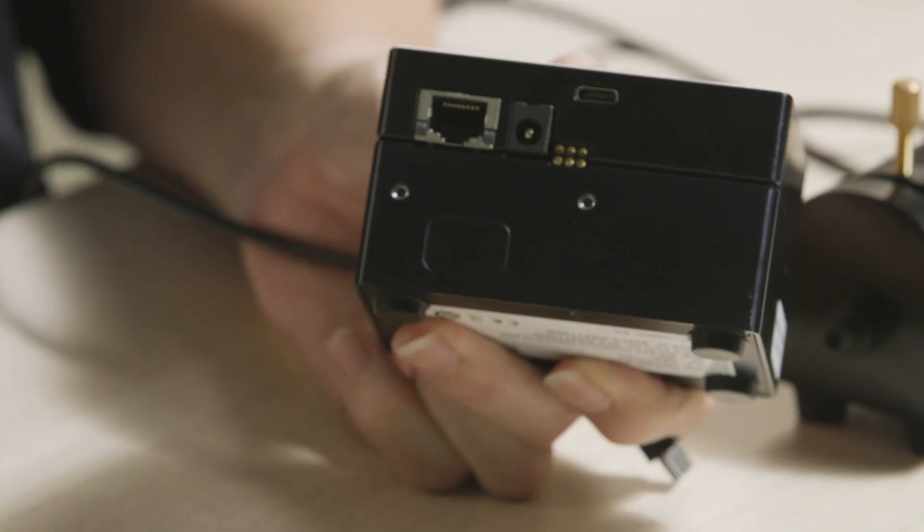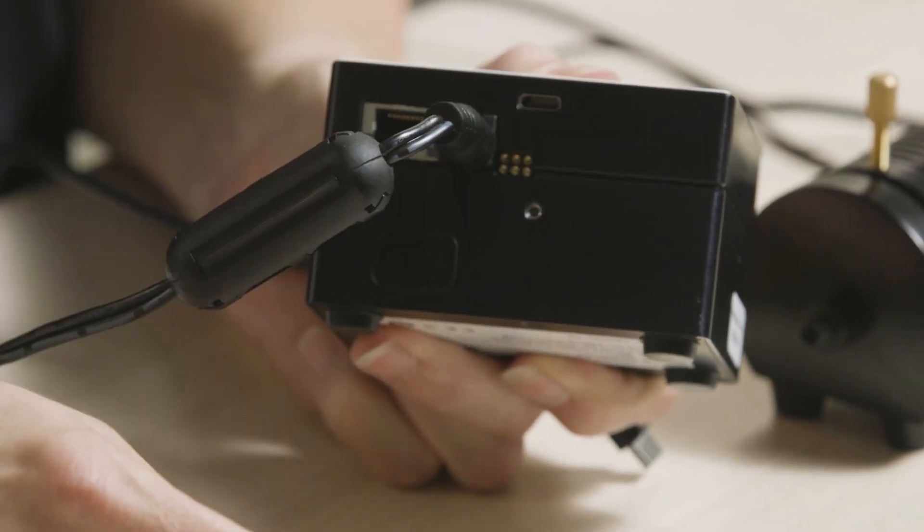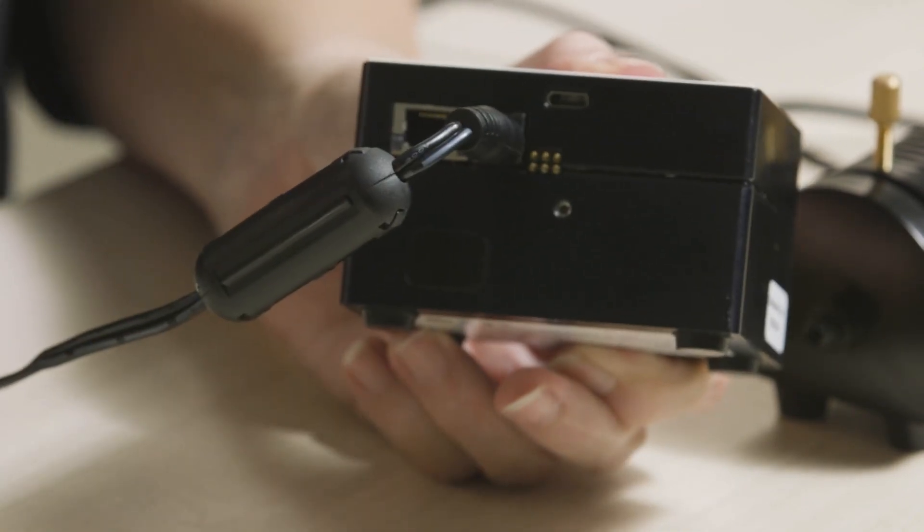The next thing we're going to hook up is our spectrometer. We'll connect our power cable and then our USB cable.